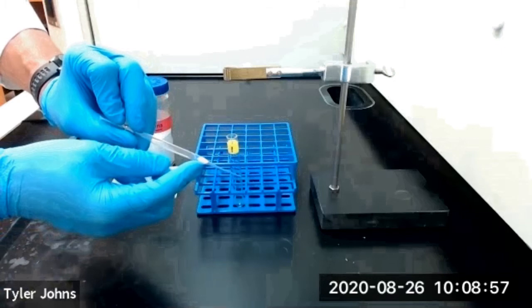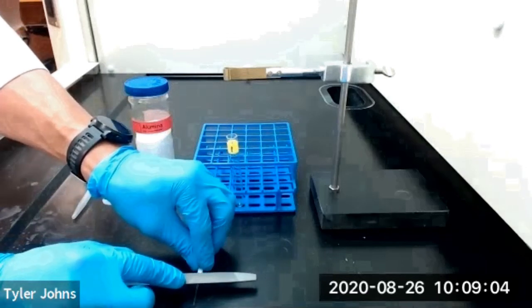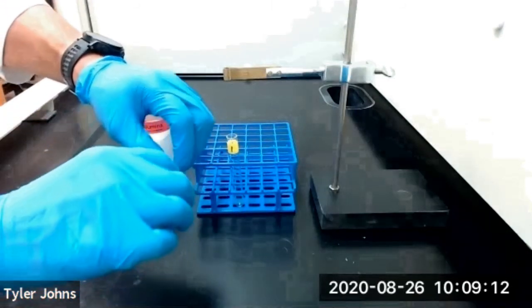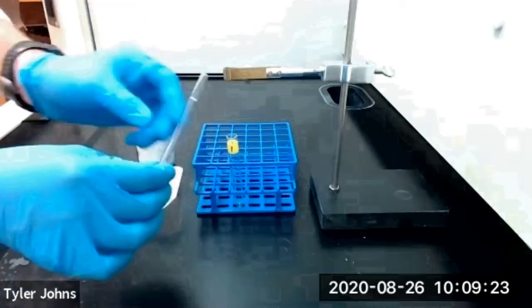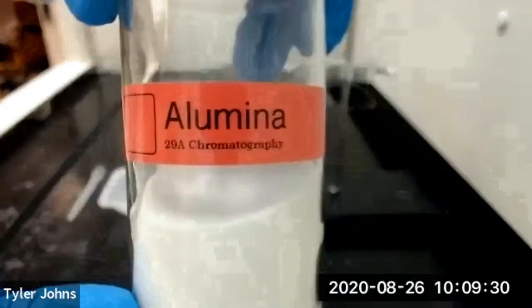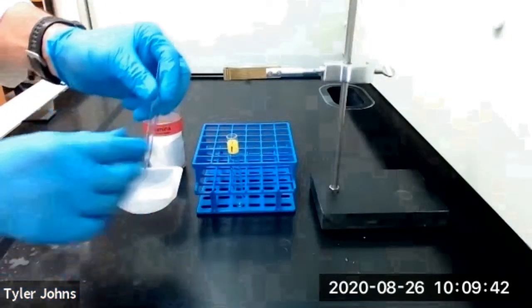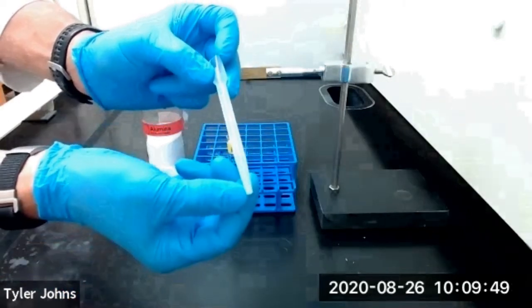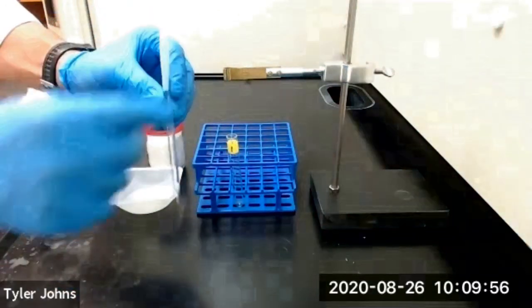Once the plug of cotton is in the end of our pipette, we're going to take a metal file and score our pipette about one centimeter below the cotton plug. We'll then place our thumbs on either side of our scored mark and push quickly. We then need to transfer our alumina adsorbent to our column. We're going to transfer 1.25 grams of alumina adsorbent to our column using a micro funnel, which is just a disposable plastic pipette that's had the tip cut off and the bulb cut in half. We'll place the tip of our micro funnel in the open end of our column.